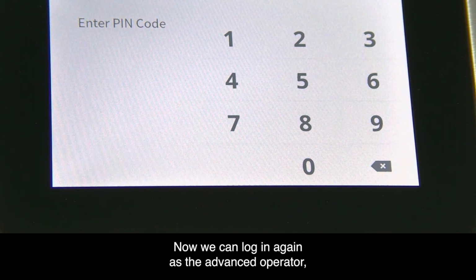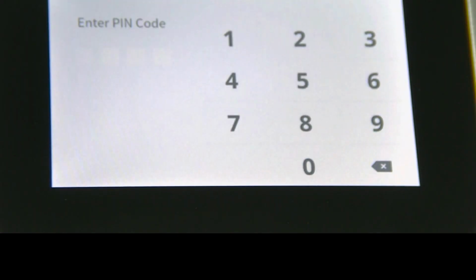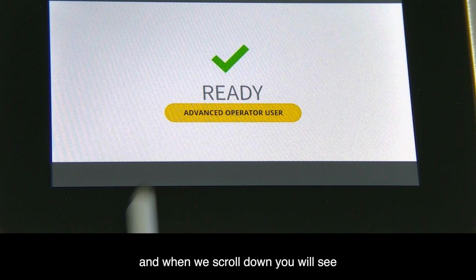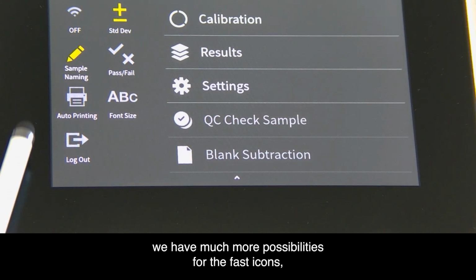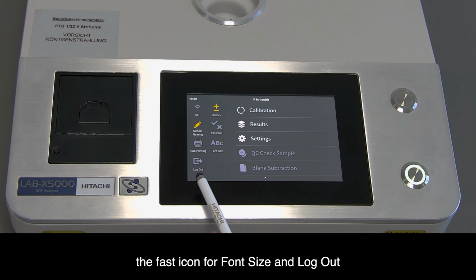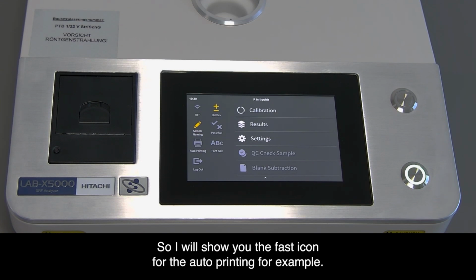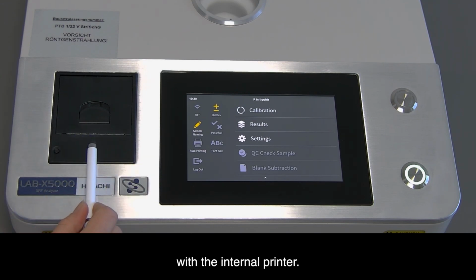Now we can log in again as an advanced operator. And when we scroll down, you will see we have much more possibilities for the fast icons. The fast icon for font size and logout you know already at this point. So I will show you the fast icon for the auto printing, for example. When this fast icon is enabled, directly when your measurement has finished, the results will be printed out with the internal printer.